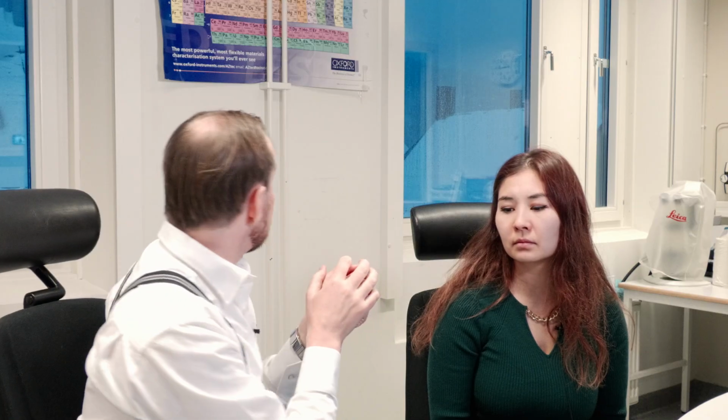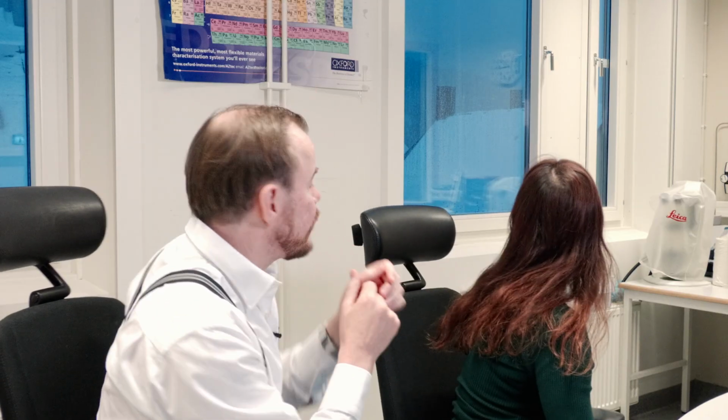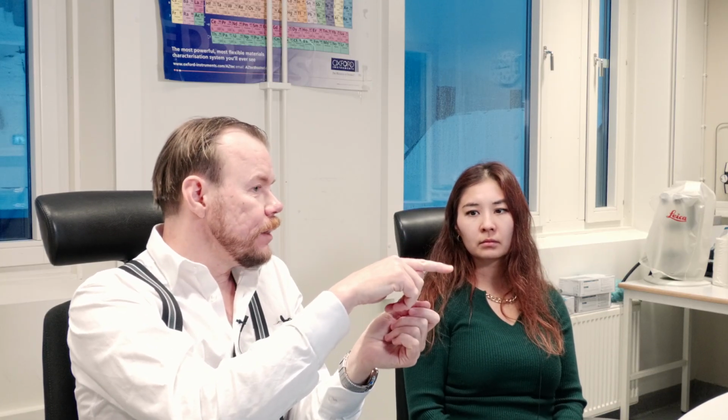And carbon has a very low energy signal. It's like 0.5 kilo electron volt or something like that. We can see it's even less, 0.27. So that means a low-energy X-ray is easily absorbed also. So then the model says, okay, if this is carbon emitting X-rays and we're measuring a lot of those X-rays, then there must be a lot of carbon inside that steel matrix, since steel is a very solid material around it. So then it must be a lot of carbon. And then it comes to doing the calculation: it must be 30% carbon to get that kind of intensity.